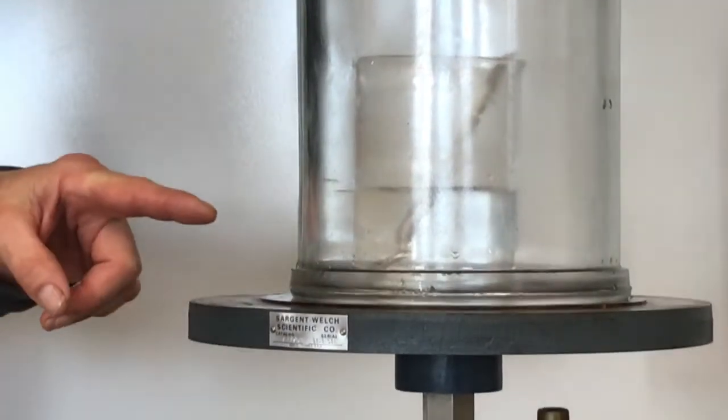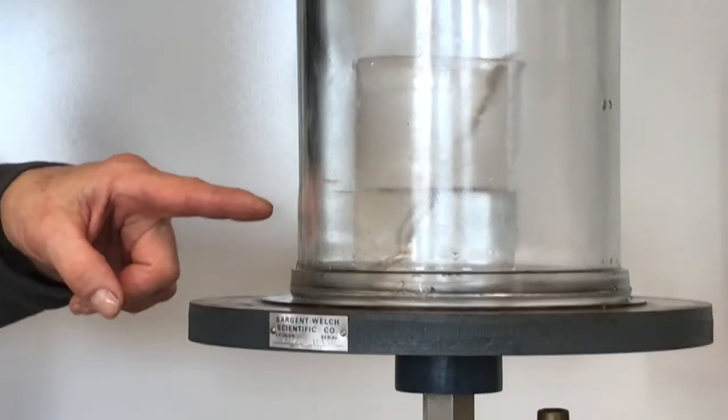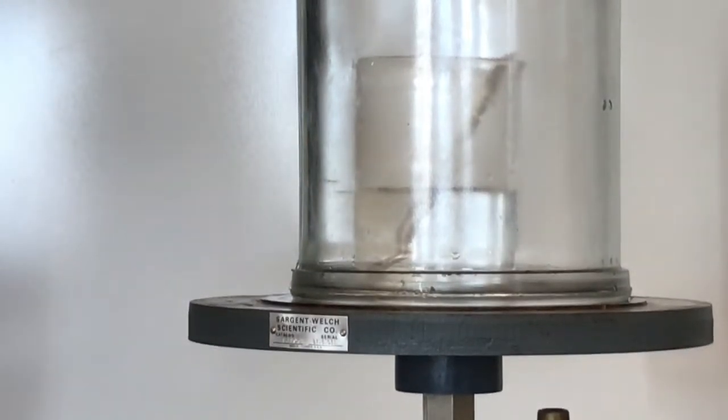Now at some point here I'm starting to see some bubbles form in the water. And I don't know if you can see that yet in the video. But at some point the water is going to be in a full boil.